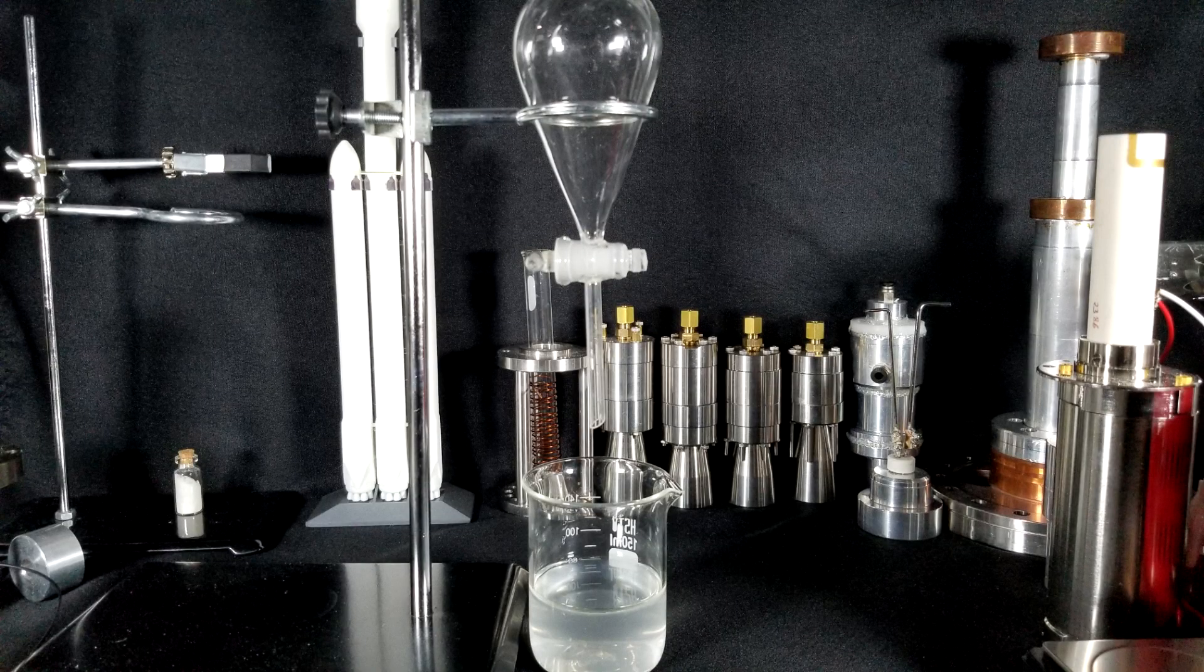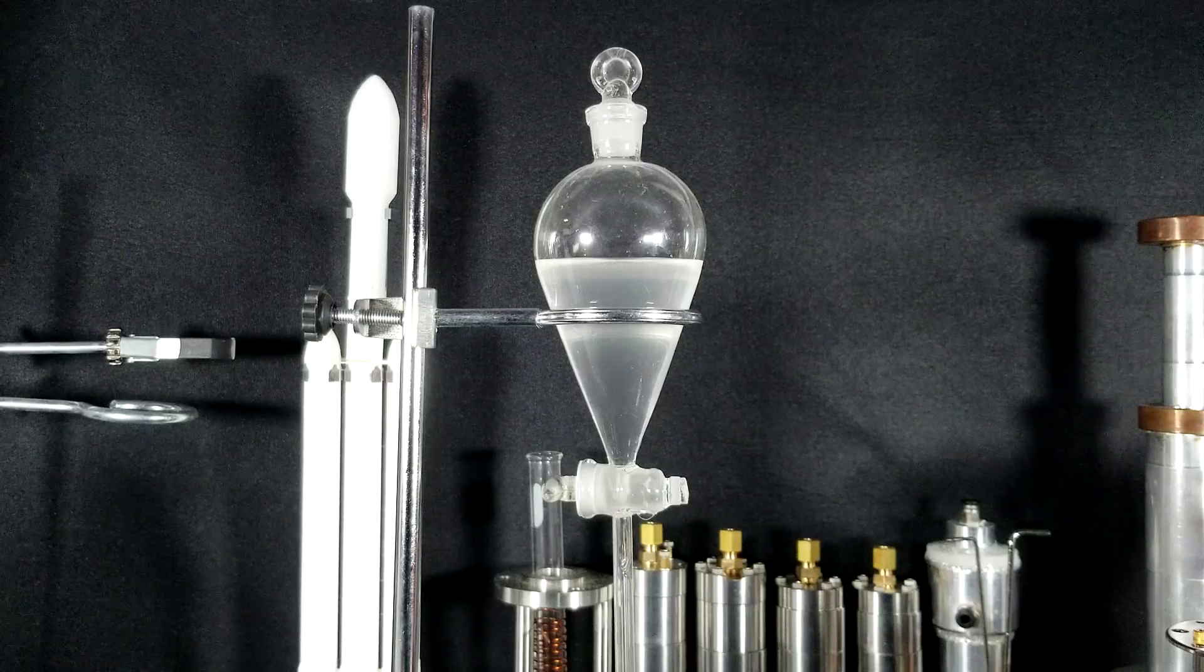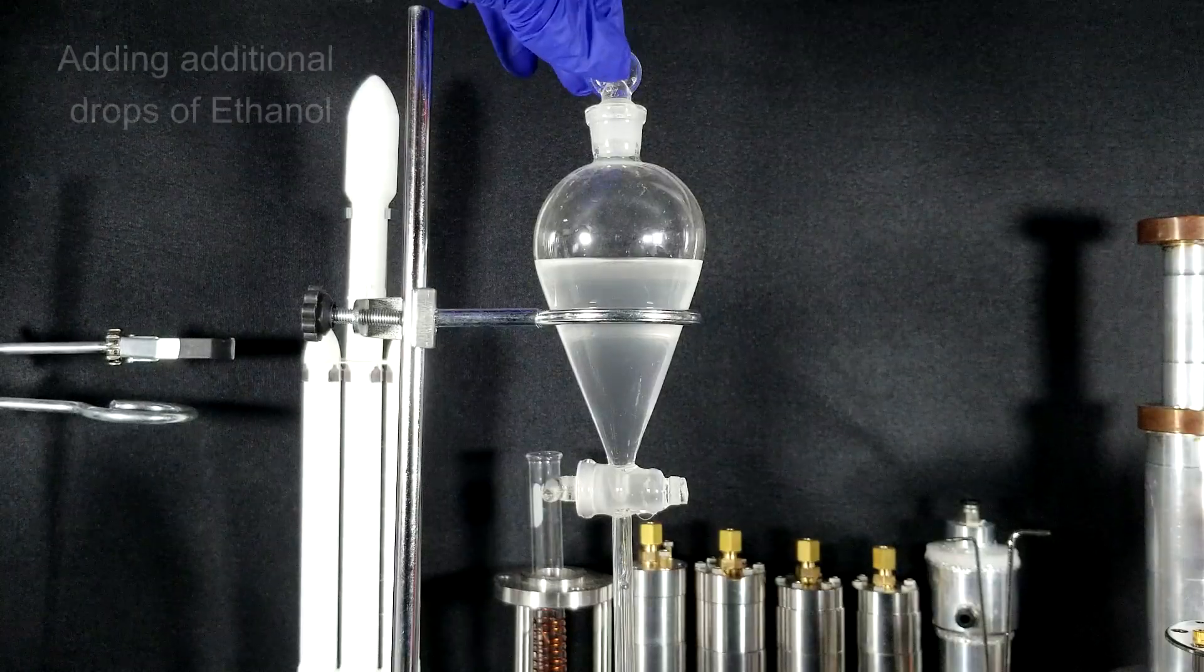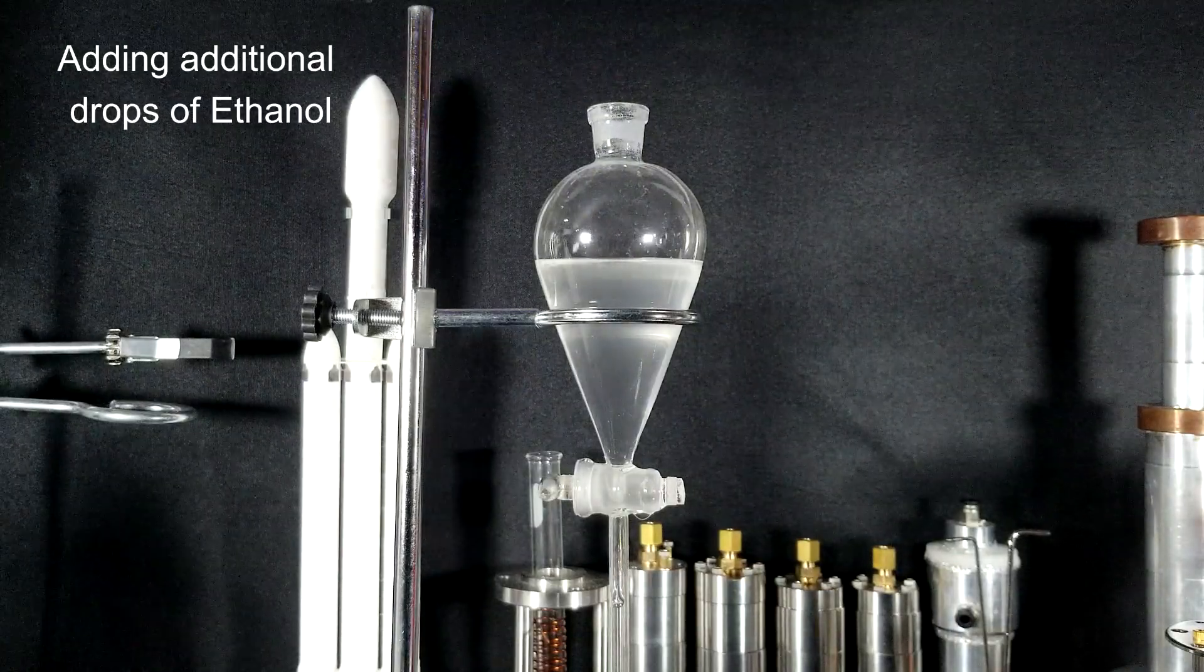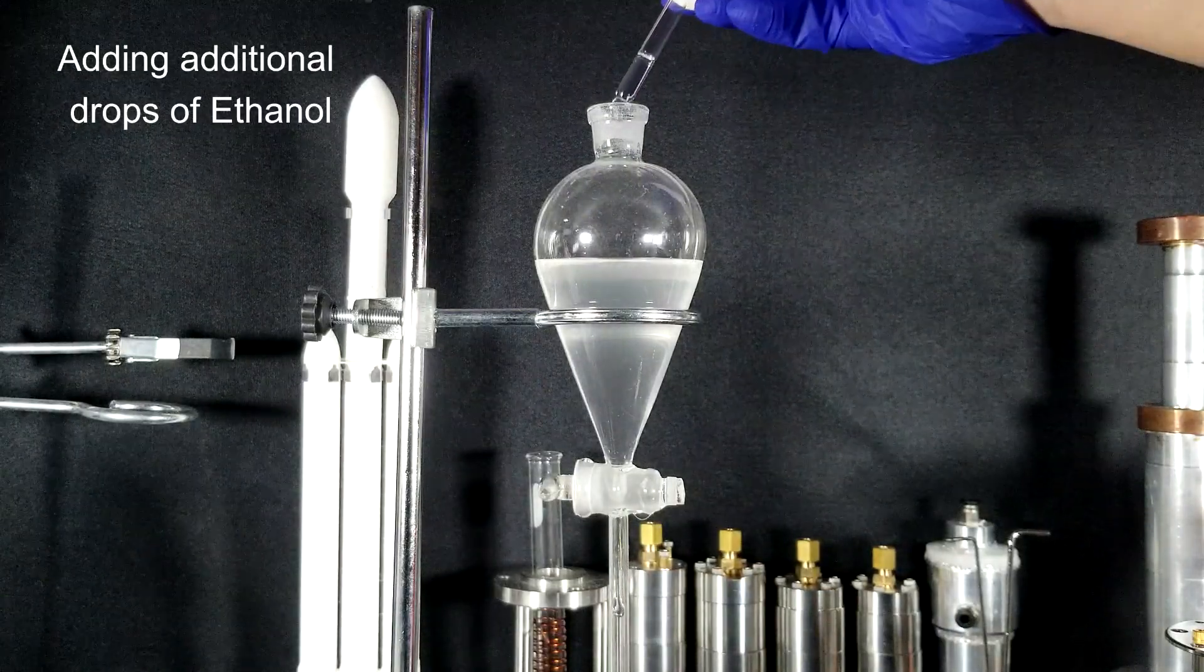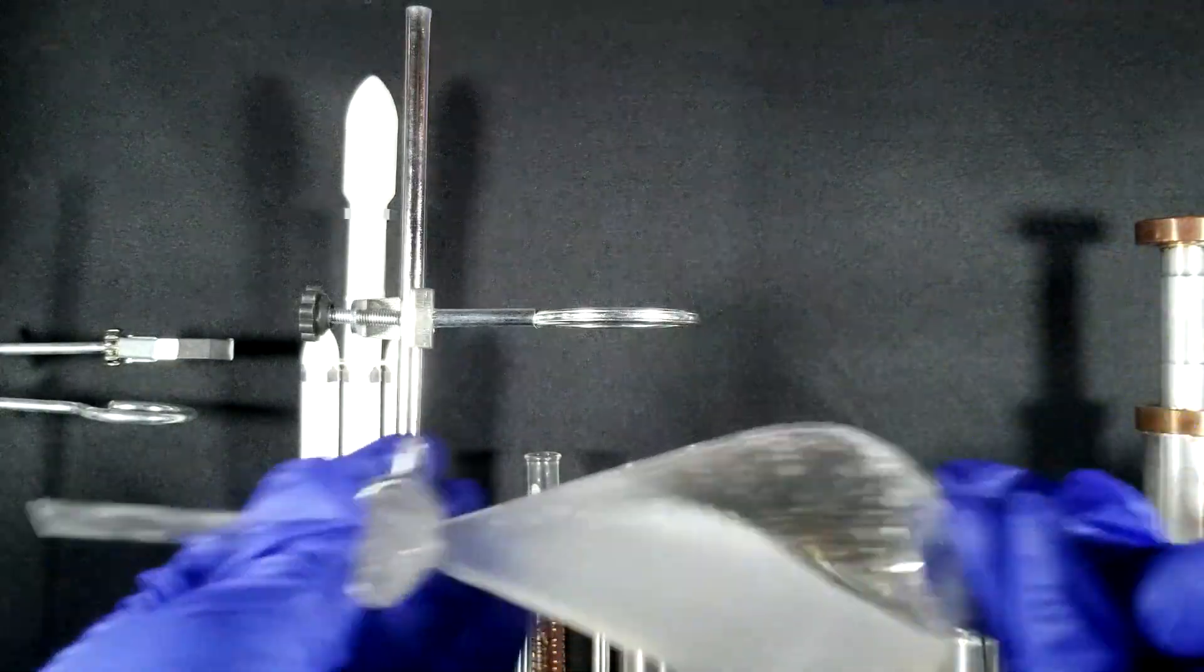Nonetheless, the next step is separation. This step is where we add our solvent, the ethanol. I added 20 milliliters of ethanol into the beaker and transferred it into the separation funnel. I then shook the funnel while releasing the pressure occasionally.